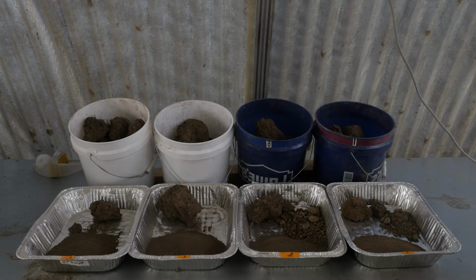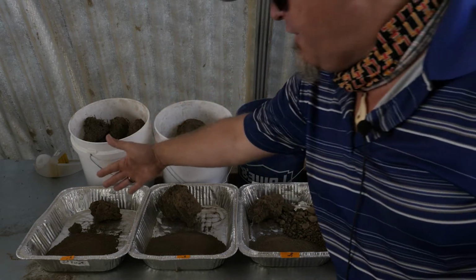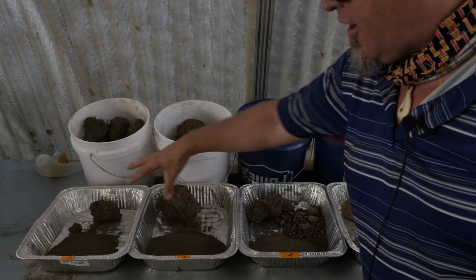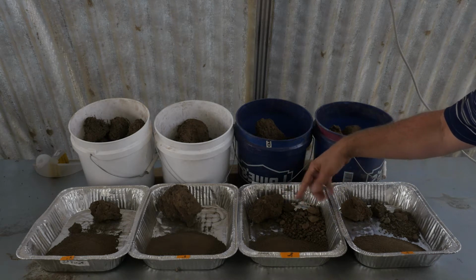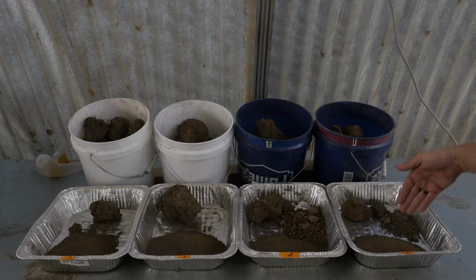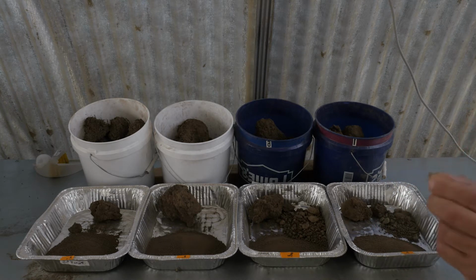All right, so now we have all of the soils that have been separated from their aggregated form here. The surface A, the second A with a little bit more aggregation. You can see getting into a Bw that starts to pick up some gravel and some of that coarser material underneath, and then down into that true C horizon with less aggregation. And the example of these fairly clean, fairly defined gravels in there.